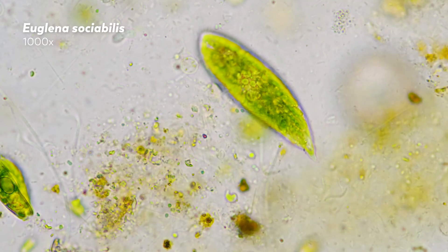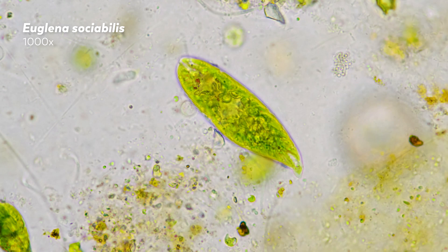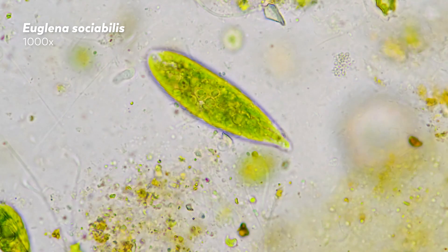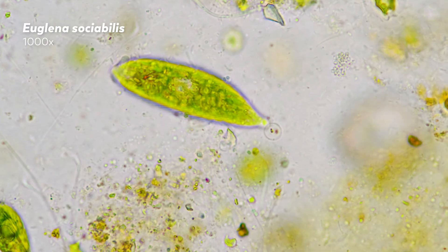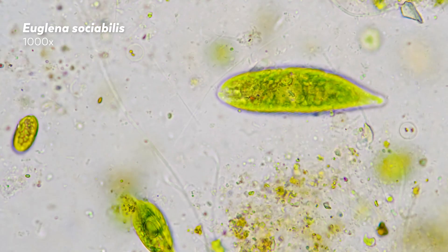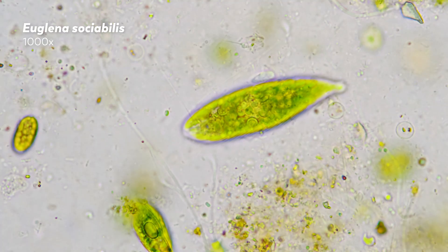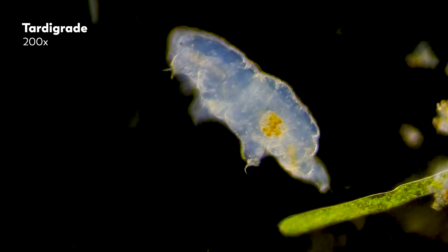Pigmented organisms are easy to visualize against the bright background, but in cases where the organism has been rendered transparent, it can be harder to distinguish their bodies from the rest of the world they inhabit. Scientists can navigate these challenges using stains that make certain structures more visible, but we like to avoid stains because they can affect the microbes themselves.